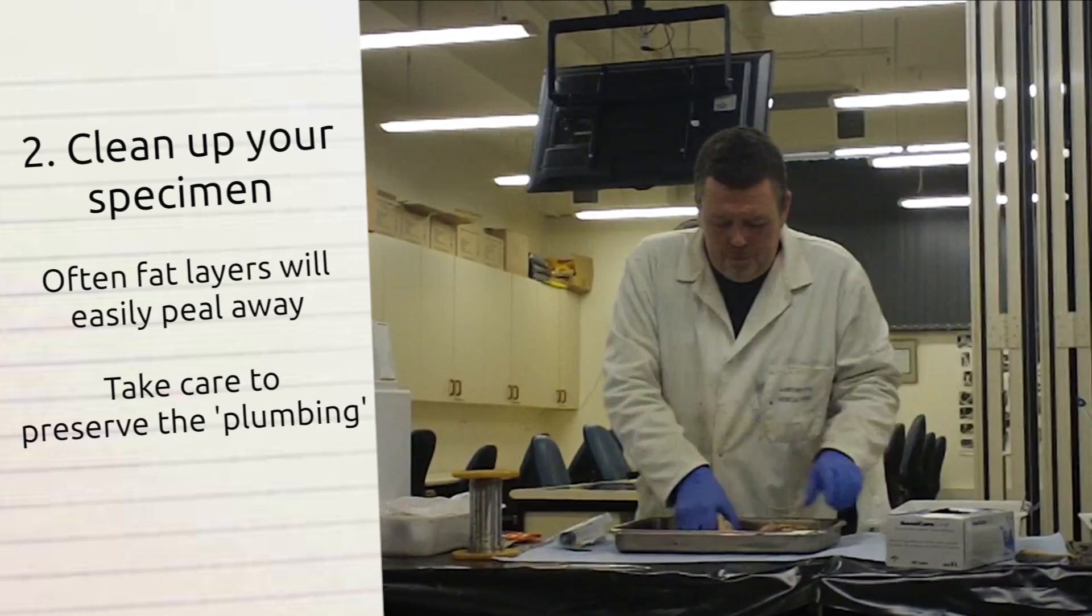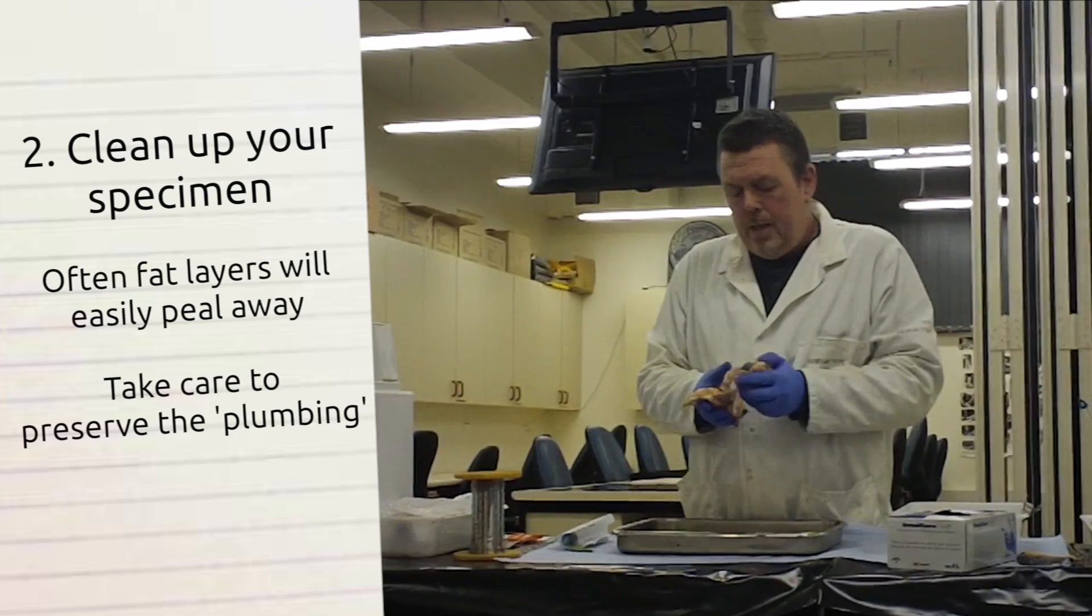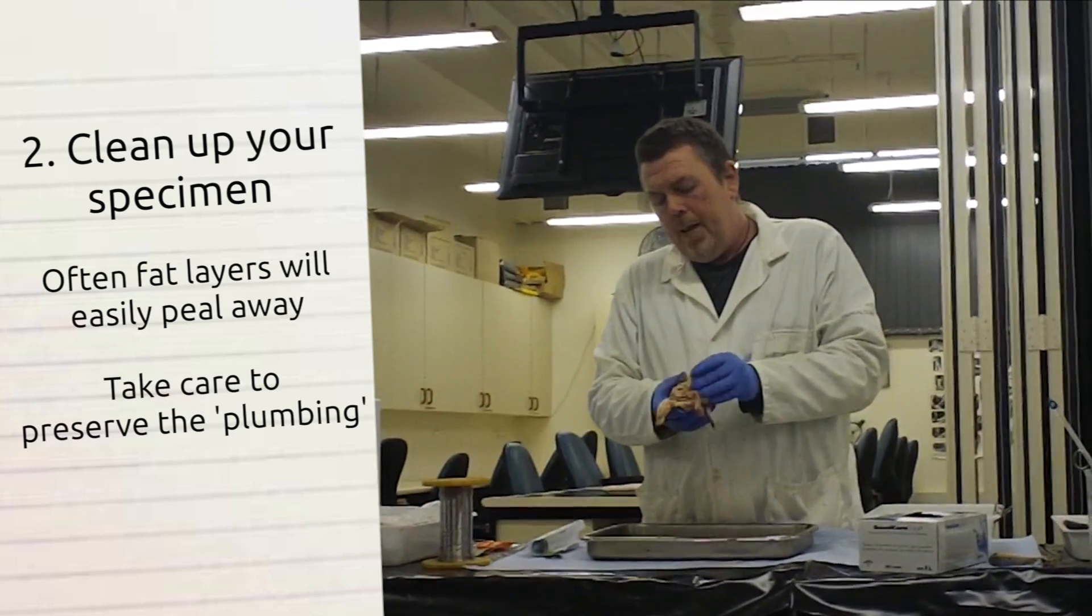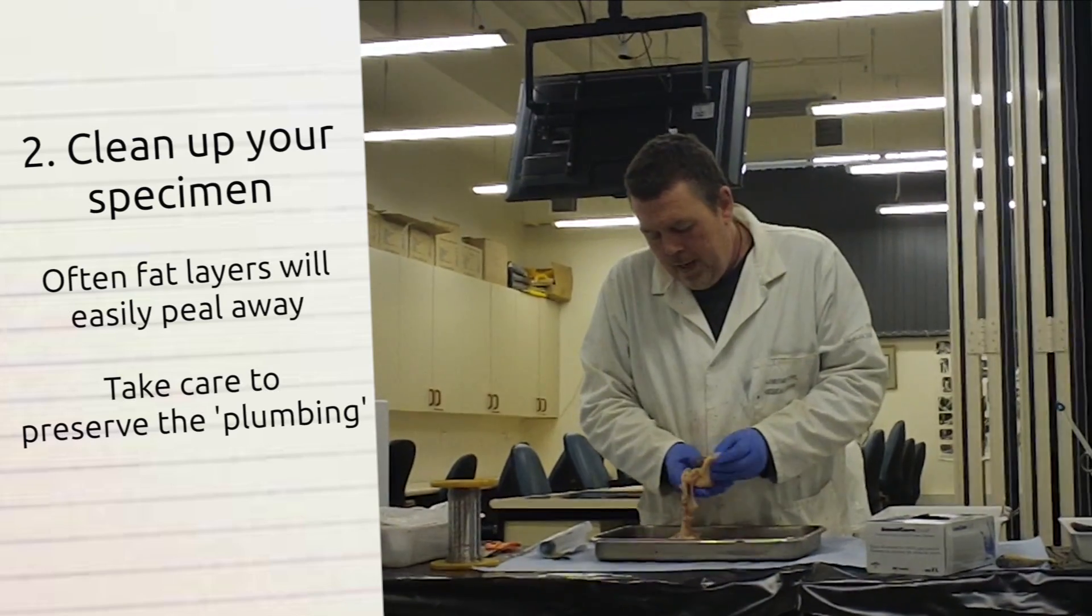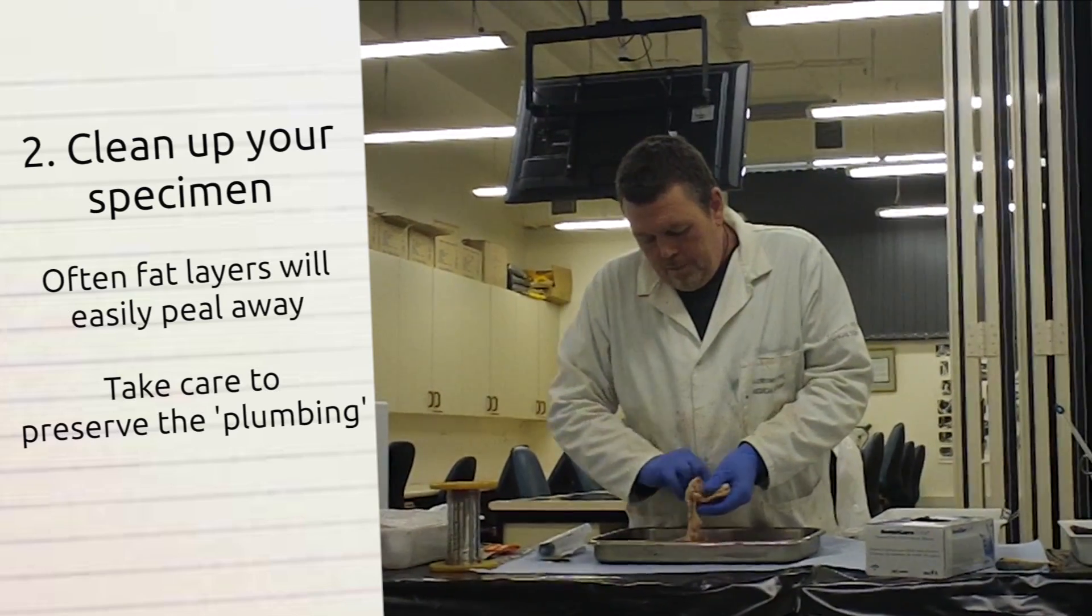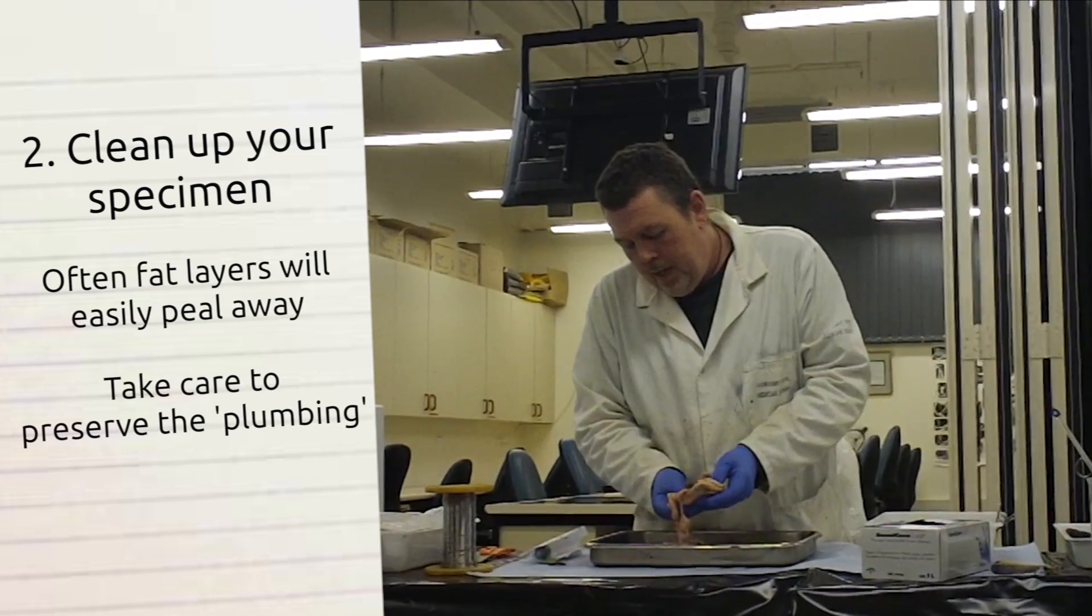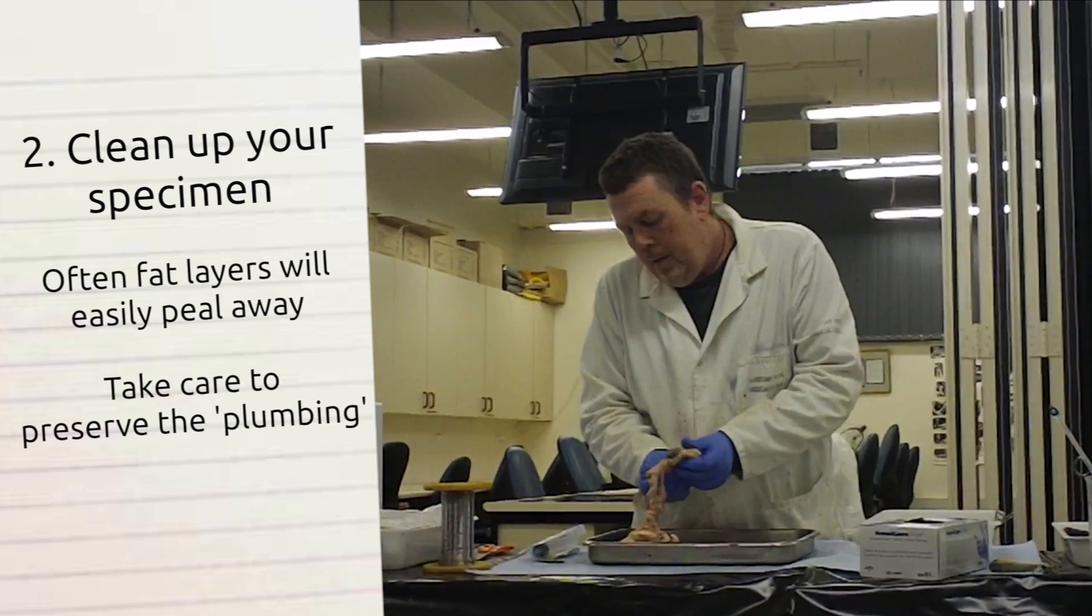This is typically how you receive a kidney, covered in fat layers. They're relatively easy to peel back. You can do it manually like that to an extent.